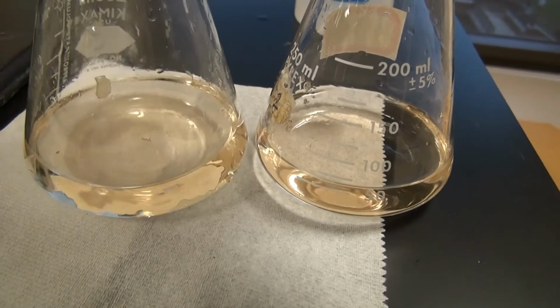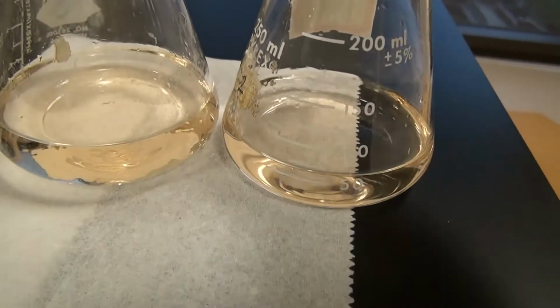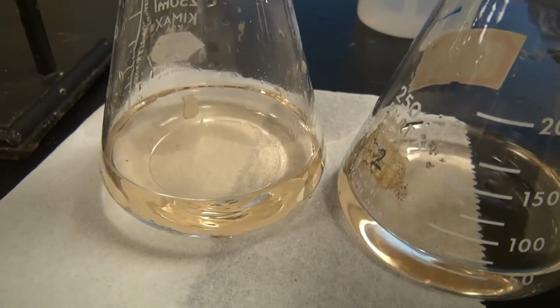I think that was it. But it just changed. But let's go ahead and do one more drop again, just to see.